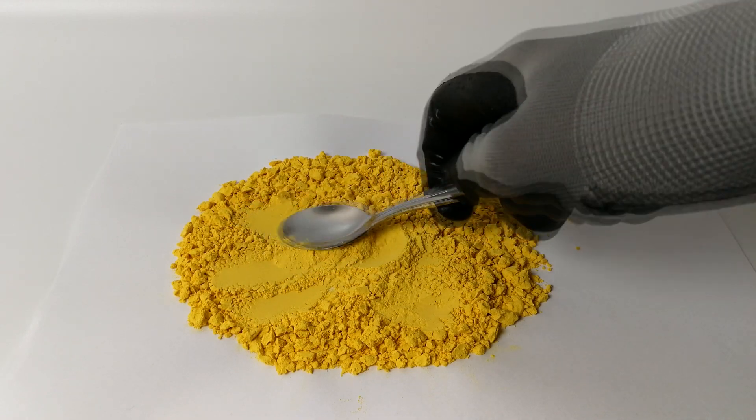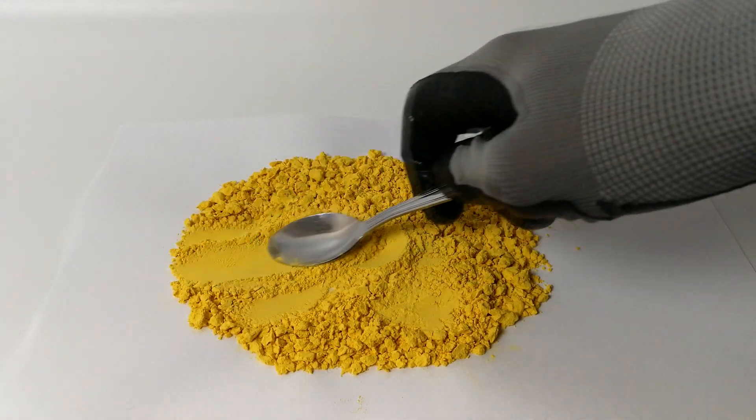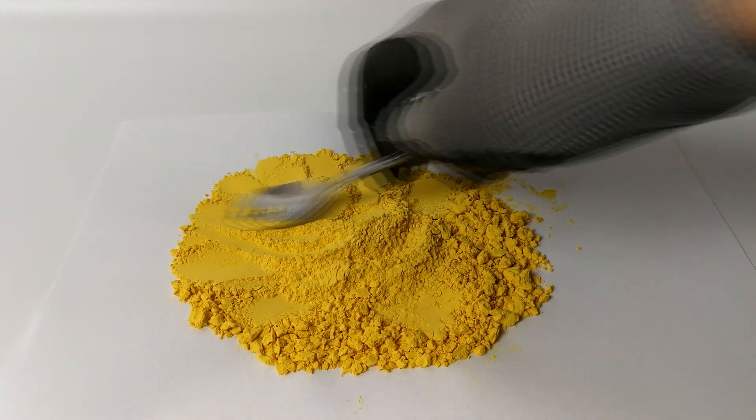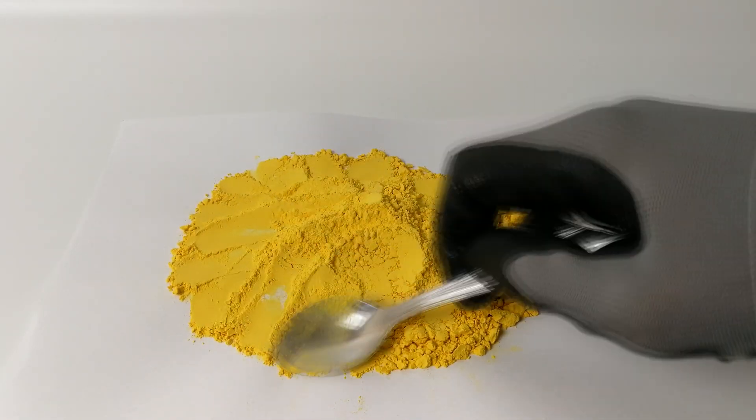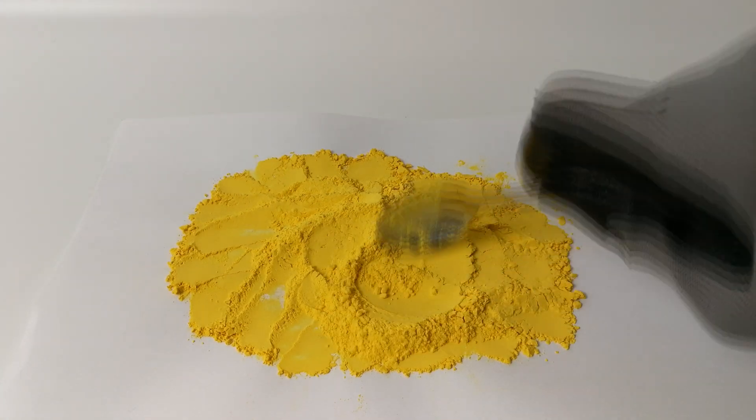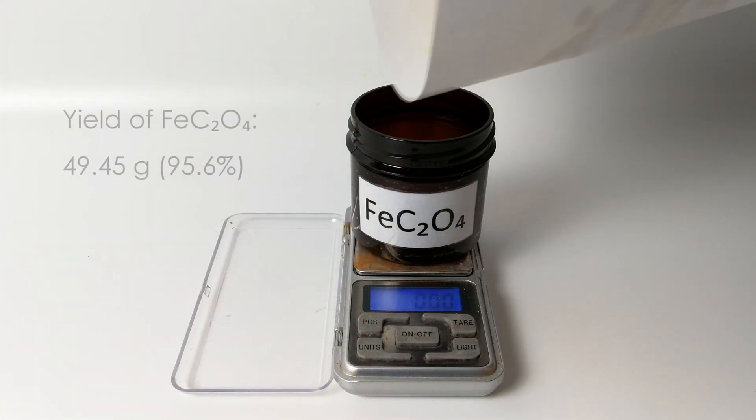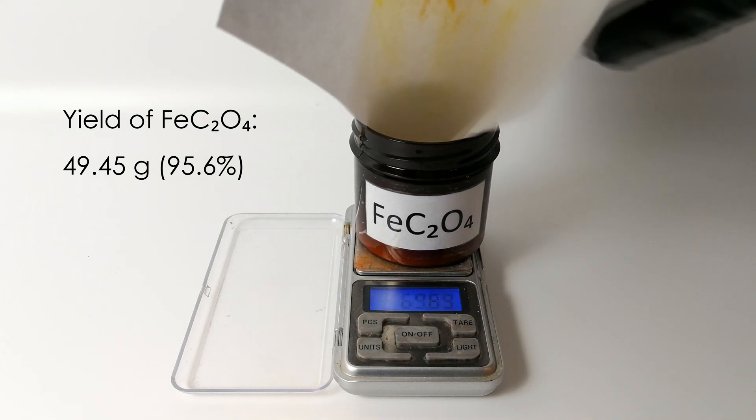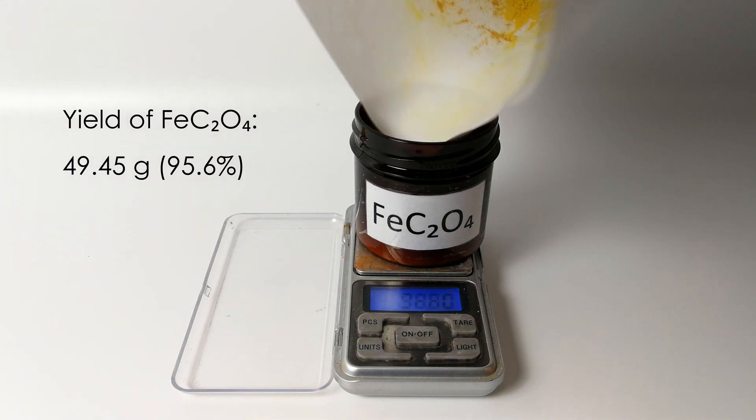After a day, our ferrous oxalate is completely dry and can be easily pulverized with a spoon. In the end, we managed to obtain 49.45 grams of ferrous oxalate, which corresponds to a percent yield of 95.6%.